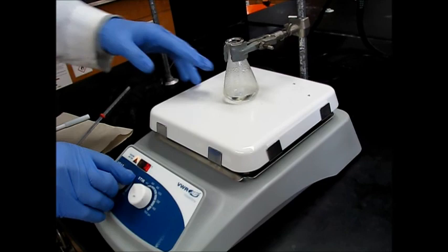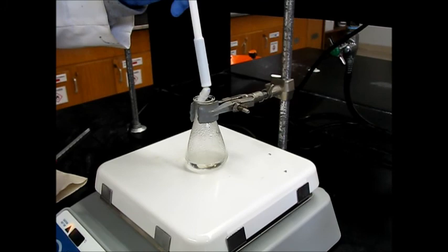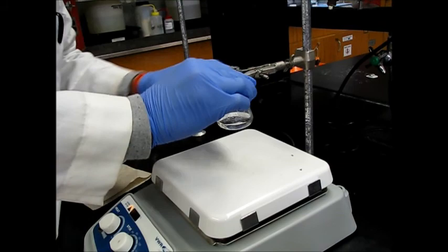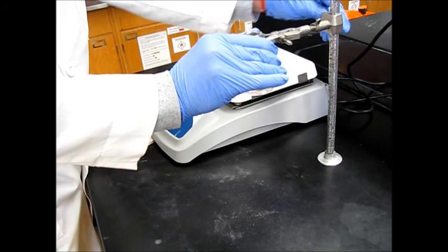So it's been another five minutes after we added those two mils of water. We're going to go ahead and turn off the heat and turn off the stirring. Get this guy out. So we're just going to take it off the heat. Make sure that's nice and tight.